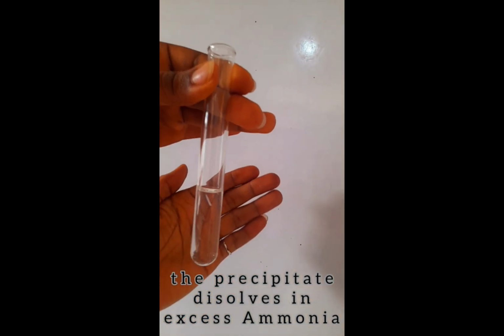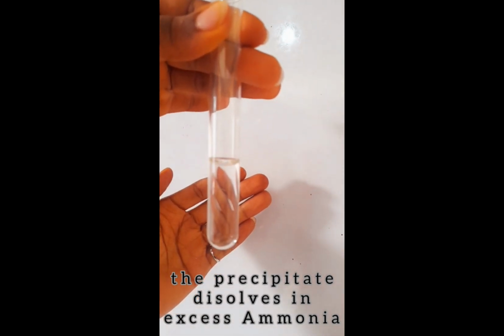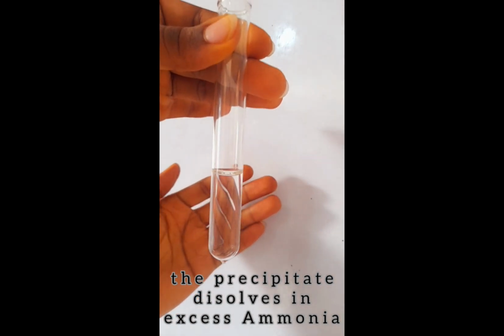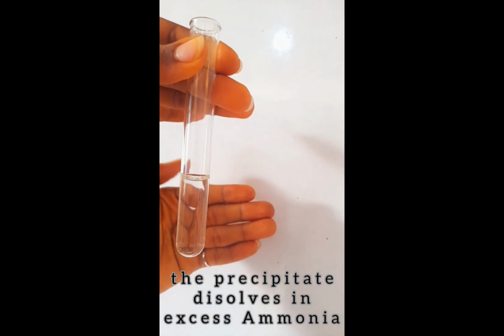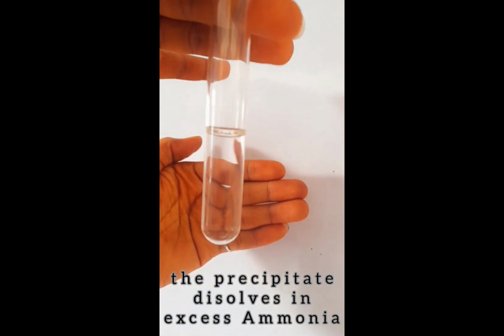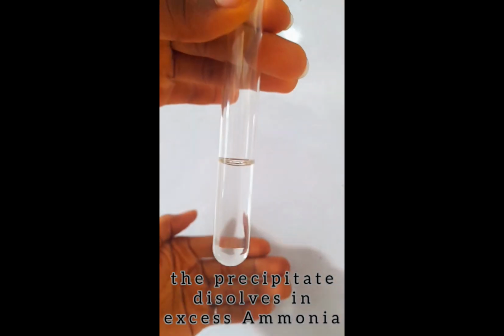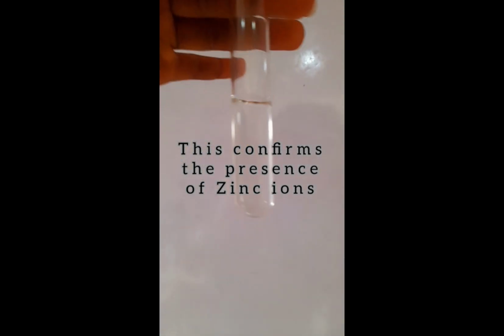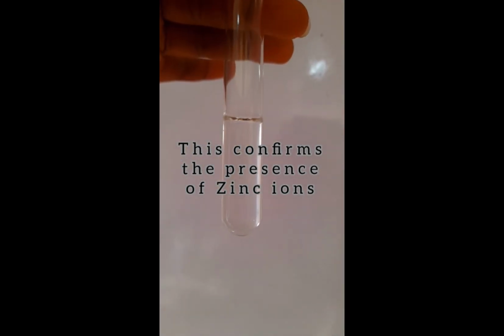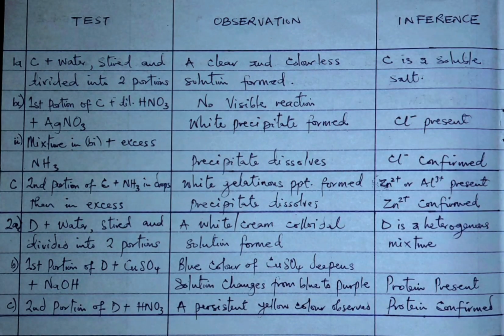The precipitate that forms when you add ammonia in drops dissolves when you add ammonia in excess. That's what is in our table. And that's a confirmation that Zn2+ is in that solution, not Al3+, like we suspected that zinc or aluminum may be present.